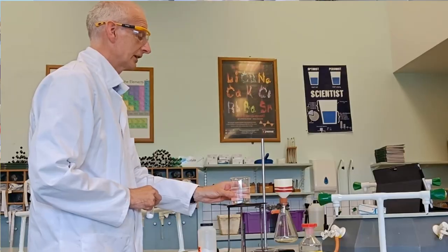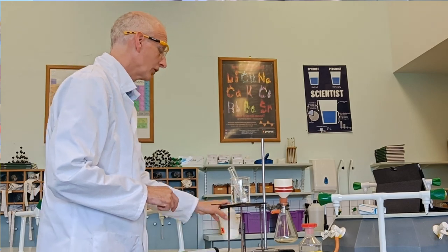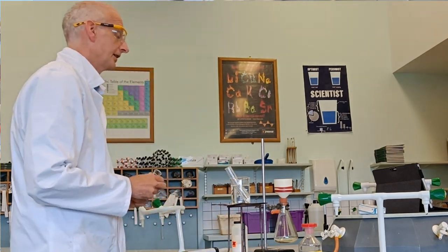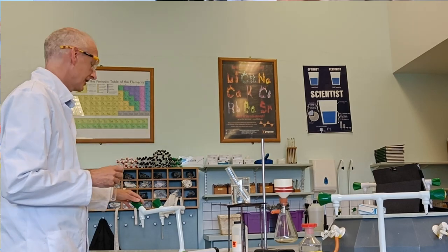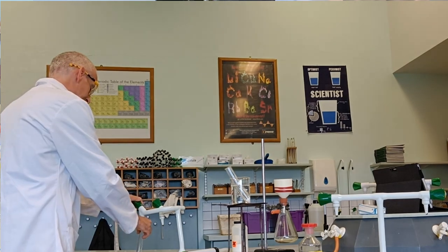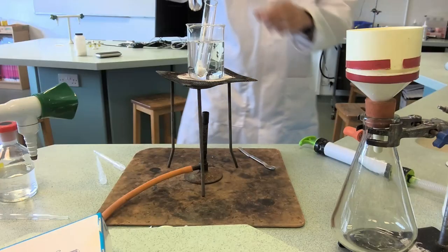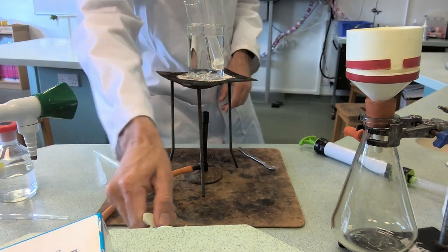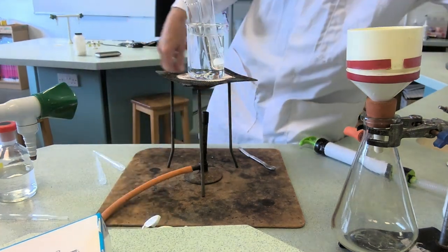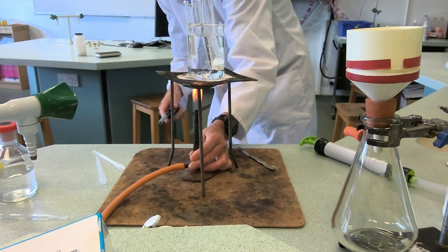This is a bit of warm water. We'll put that in there. We need a solvent - we're going to use water. We could use deionized water, but this is just a demo. We'll put the solvent in the water bath as well and light it up to get it nice and hot.